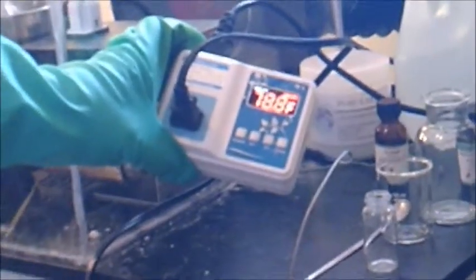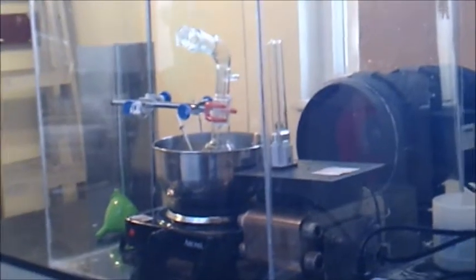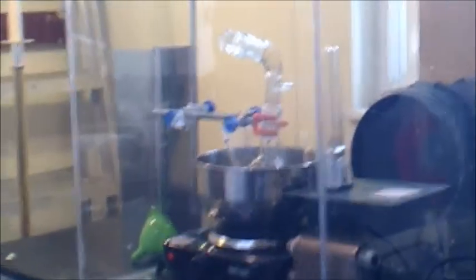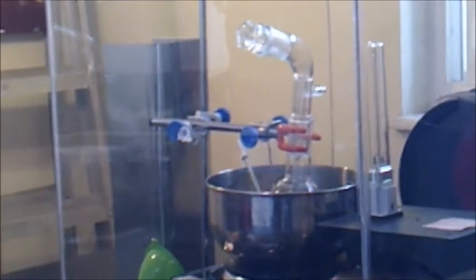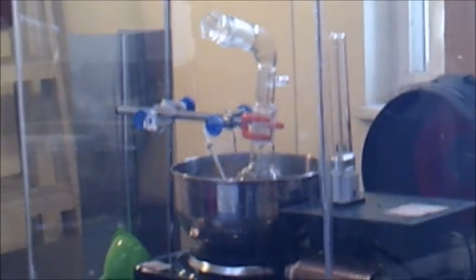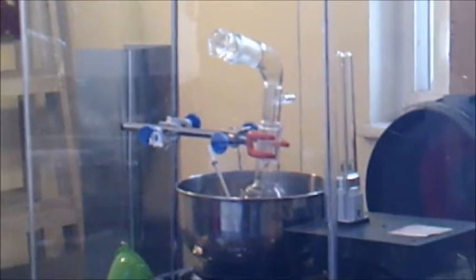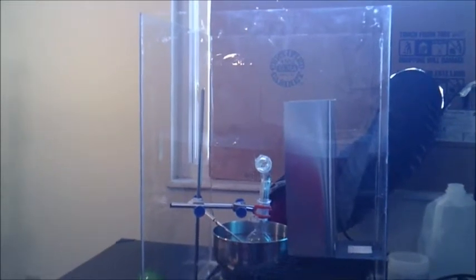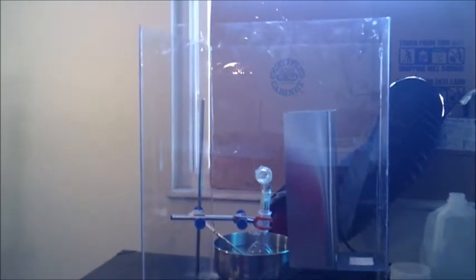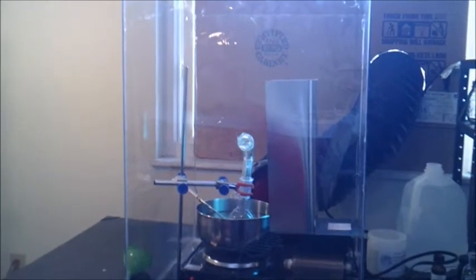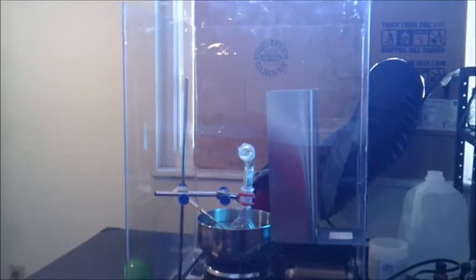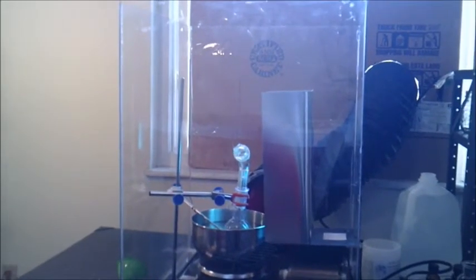And here it is, here's our temperature controller which will keep the oil bath at around 266 Fahrenheit. Okay and so next I'm going to fit the UV lamp with the metal shield because you're not allowed to look at it directly because it will damage your eyes. Okay and so now here's the completed apparatus with the metal shield in place and the UV lamp on. And so we're heating this mixture as well as shining UV light onto it. And this reaction will proceed for the next 48 hours.